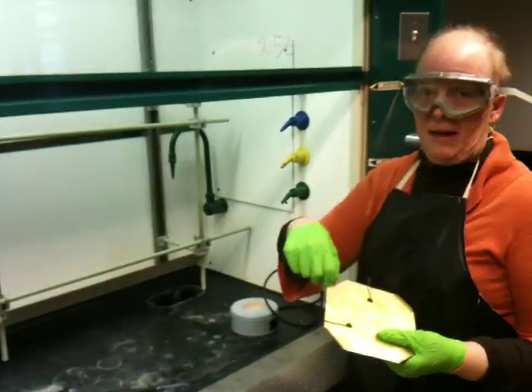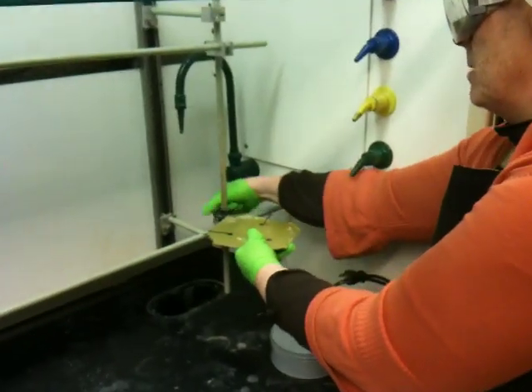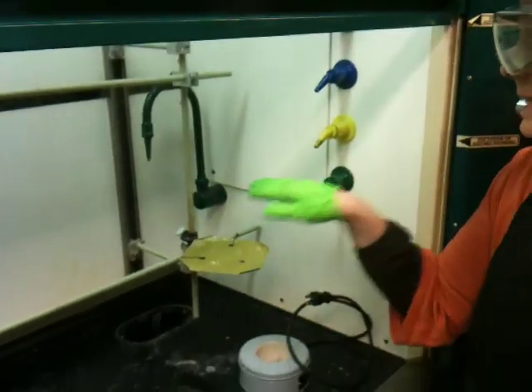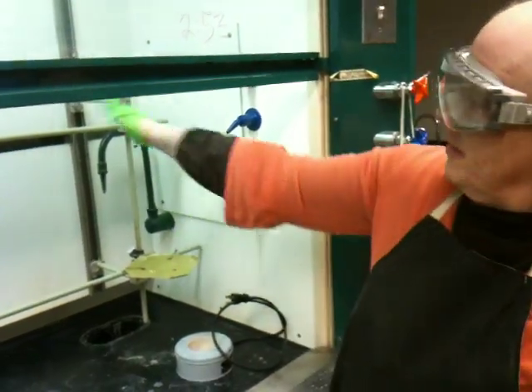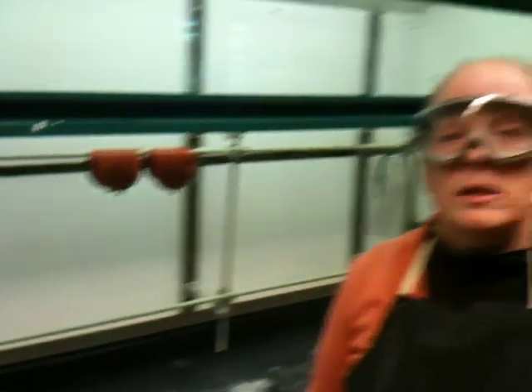The first thing you need to build a still is a platform. You should put the platform at the bottom of the monkey bar. Notice I'm building the still in the corner. If you are working over here, you should build in this corner and build this way. And if you're working in this corner, you should build the still here and work this way. In other words, the stills should be mirror images of each other.